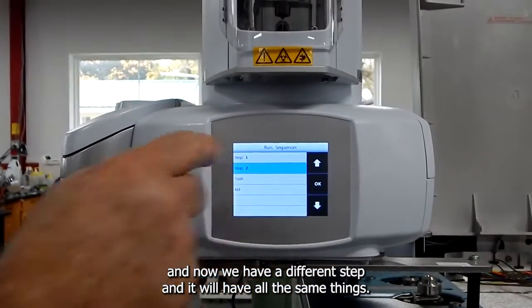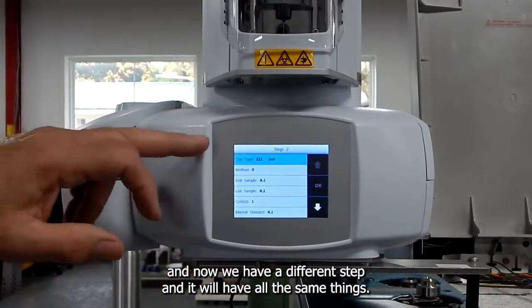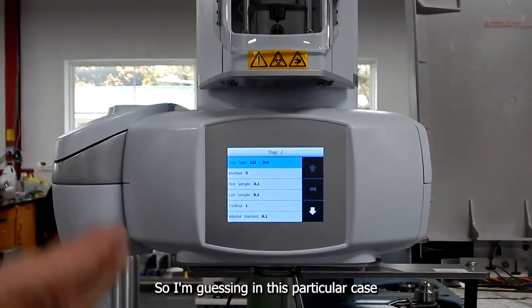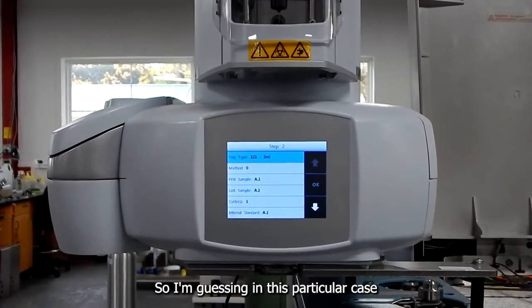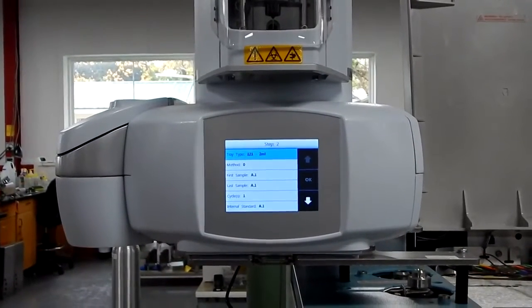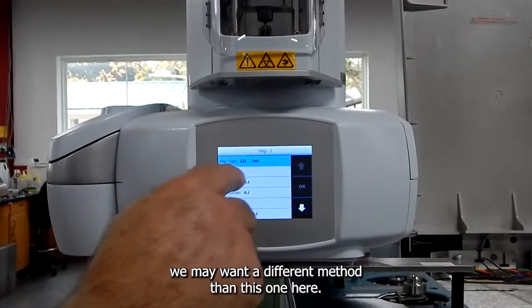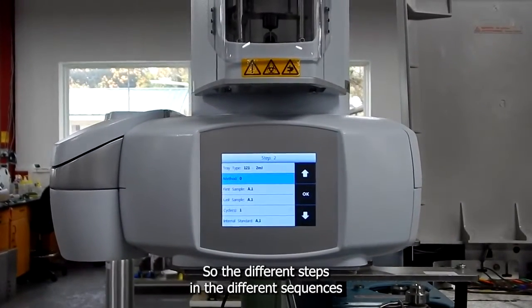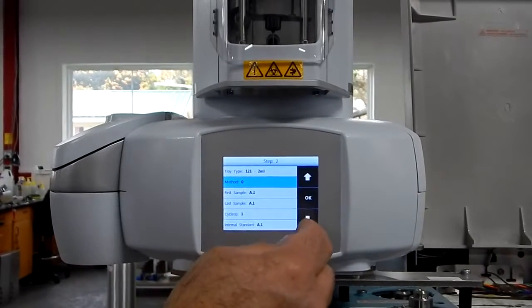And now we have a different step, and it will have all the same things, but we may want to use another injection port. So I'm guessing in this particular case it will take that injection port, or we may want a different method in this one here. So the different steps and the different sequences.